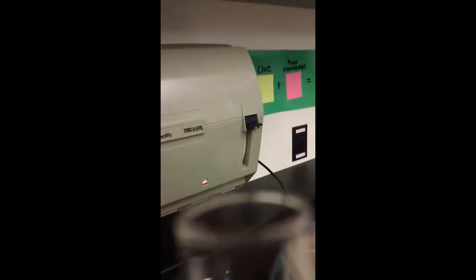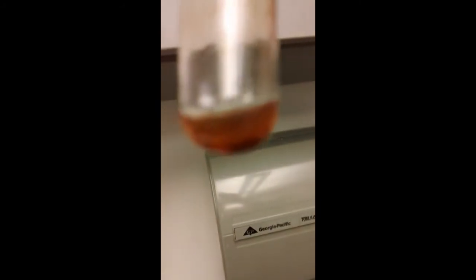Okay, I'm going to do that. Just give me a moment. Thanks for being patient while I do this. Removing the liquid from the solid, I am putting the liquid down the sink only if it formed a solid. Trying to leave as much of the solid behind and only taking up the liquid. Okay. So notice how I have the solid down there. There's a little bit of liquid left, but now I'm getting to the point where I'm picking up my solid, so I'm going to leave that part behind.